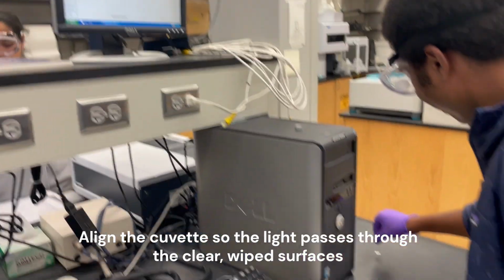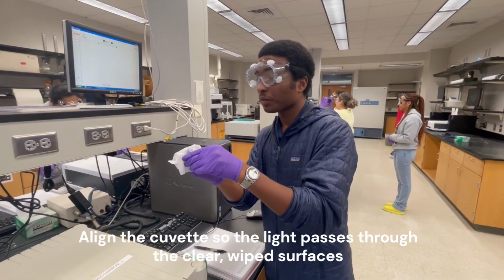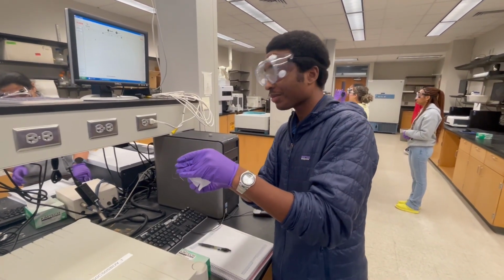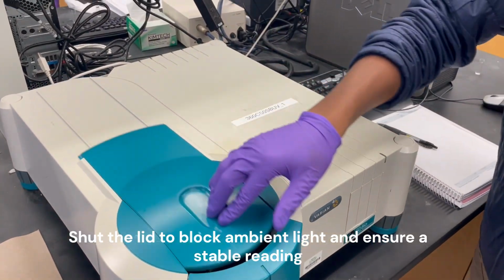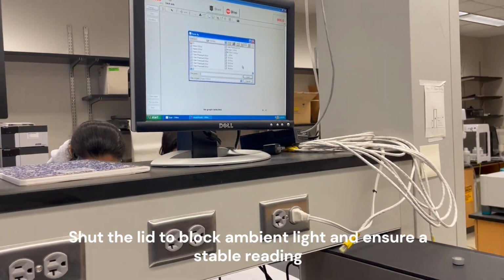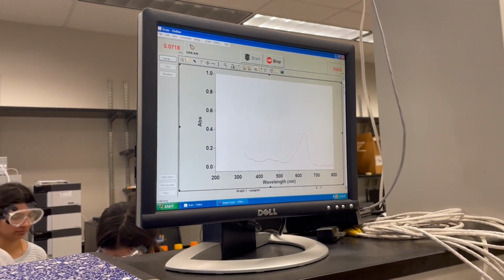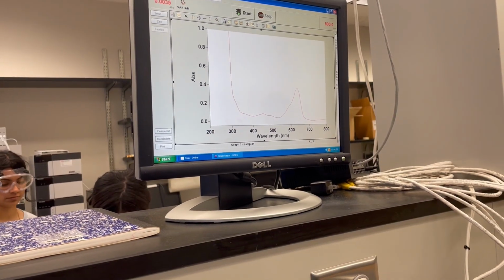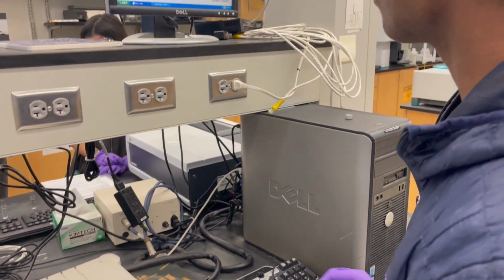It's 7.45. I'll speed it up, bro. But less than 5. Oh, okay. How do I hold it? No, start. So 6. 6:30. 6:33. So you don't have to take it back out. You just go to simple reads.